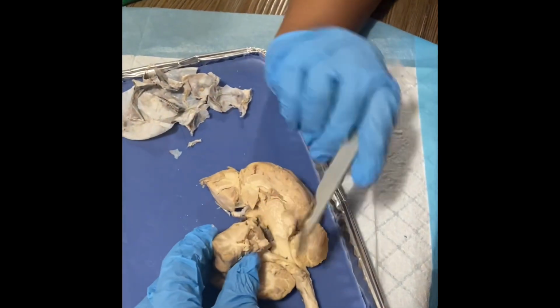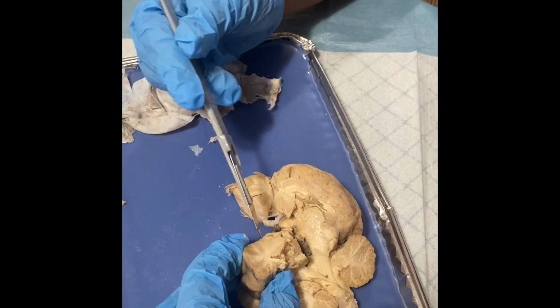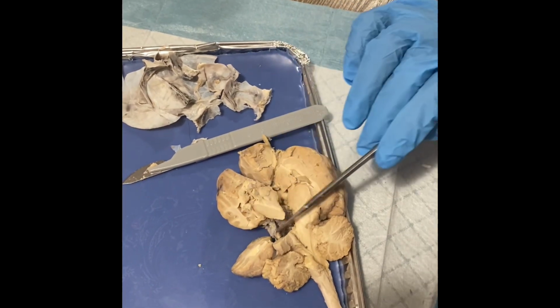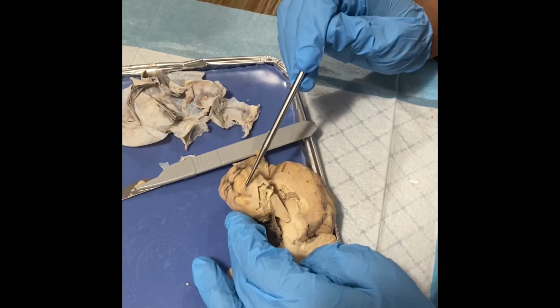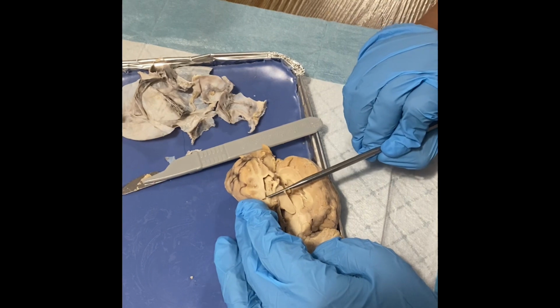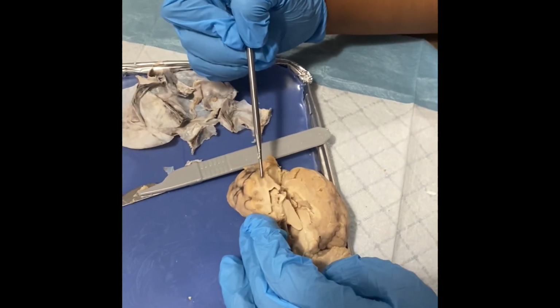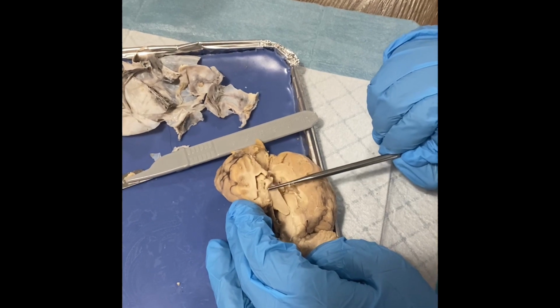These frontal cuts will show you the basal ganglia structures. Here, as you can see, I have done frontal cuts, one right here and one right here. And right here, we have the corpus callosum. A little below it, we have the caudate nucleus. And then a little to the right, we have the putamen. And at the bottom is the anterior commissure.